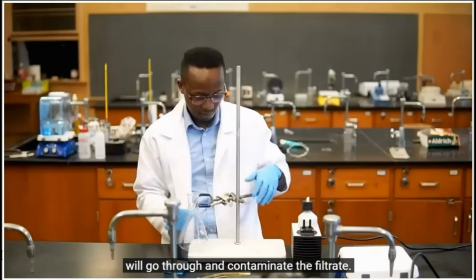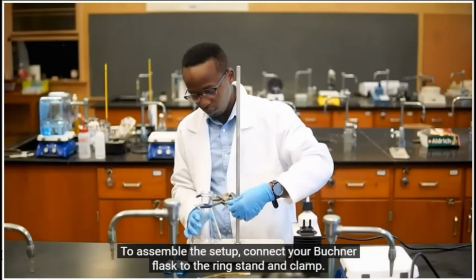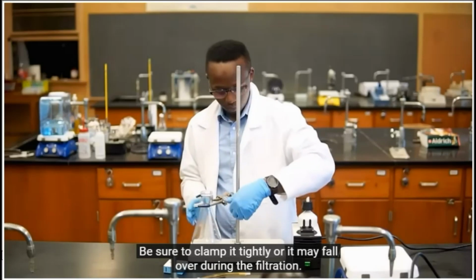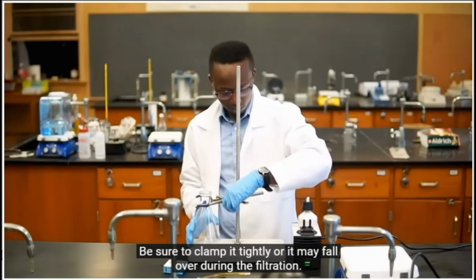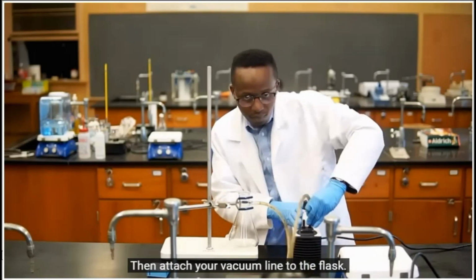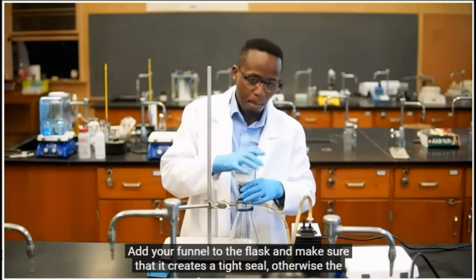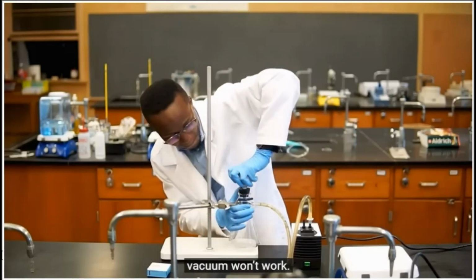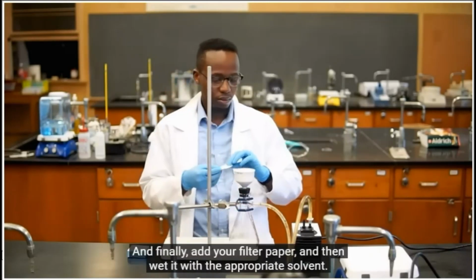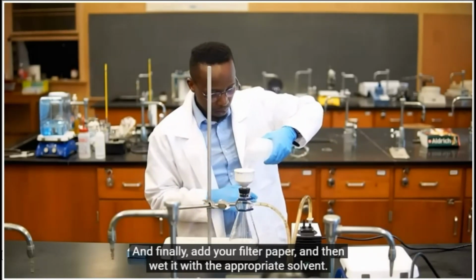To assemble the setup, connect your Buchner flask to the ring stand and clamp. Be sure to clamp it tightly or it may fall over during the filtration. Then attach your vacuum line to the flask. Add your funnel to the flask and make sure that it creates a tight seal, otherwise the vacuum won't work. And finally, add your filter paper and then wet it with the appropriate solvent.